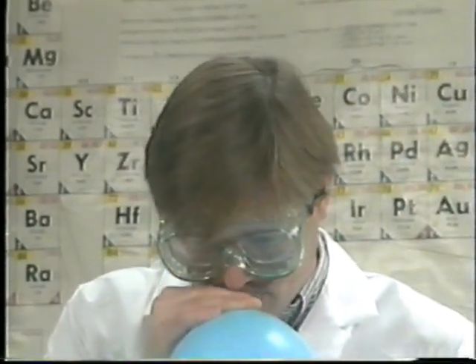Now, I'll take just one more swig of this sulfur hexafluoride so you can just really tell how this works. Oh, boy. Oh, I almost threw up on that one. So, the molecules are so heavy.